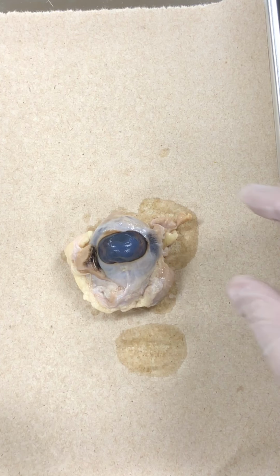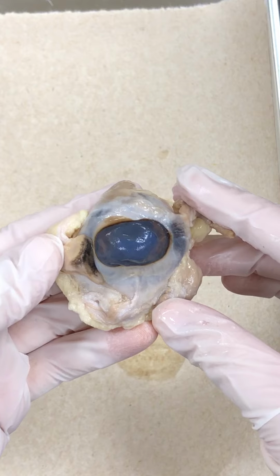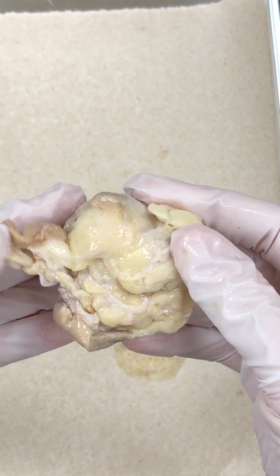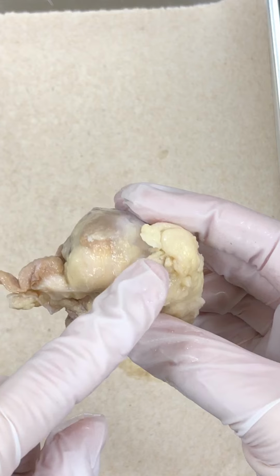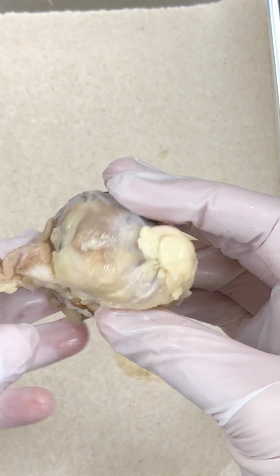Right, class, this is our sheep eye dissection, and here's our sheep eye. And we can see the anterior structures there. We flip it onto the back. Here are our posterior structures, lots of tissue back here depending on how they cut the specimen. All the yellowish, whitish areas that we see, that's fat tissue or adipose tissue.